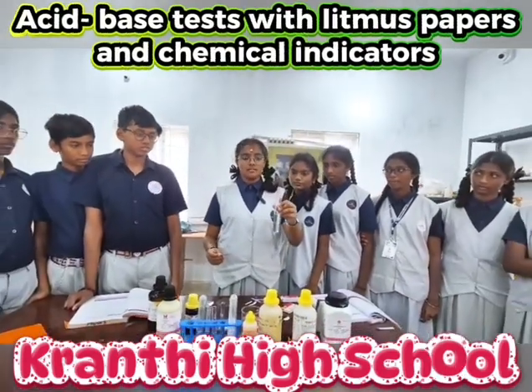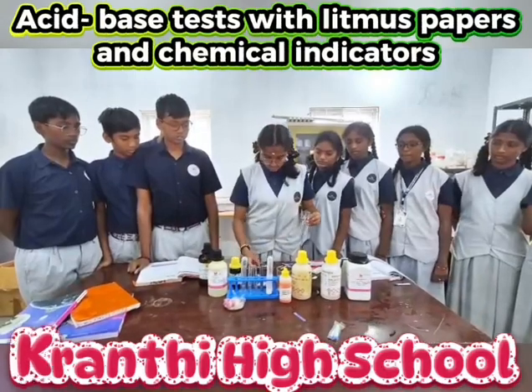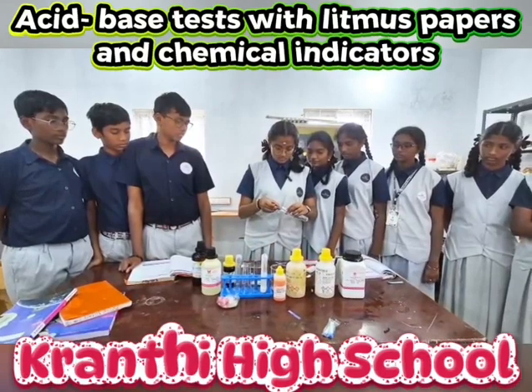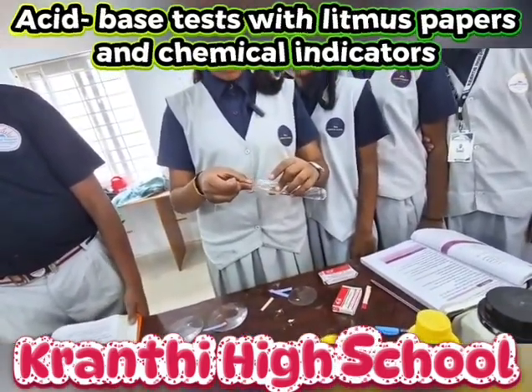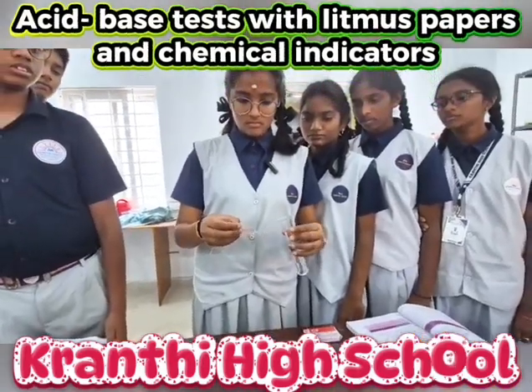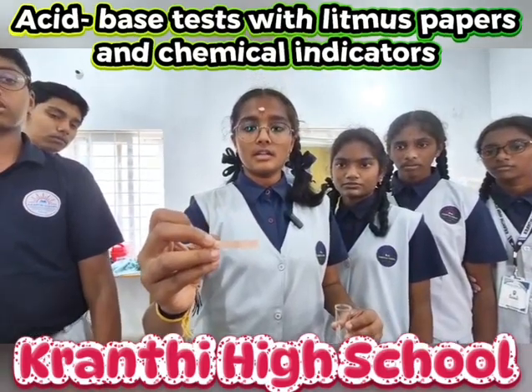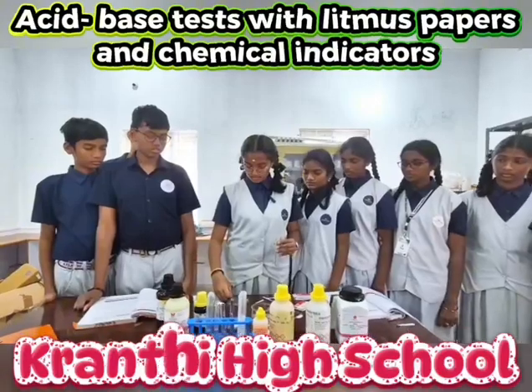This is sulfuric acid which is diluted, as well as we'll dip red litmus paper into it. As you see, the red litmus paper did not turn into any color because it is an acid.